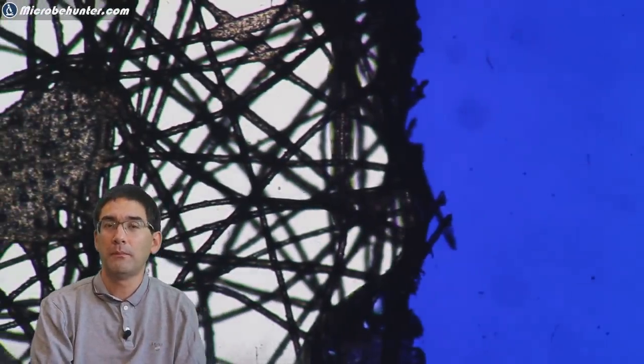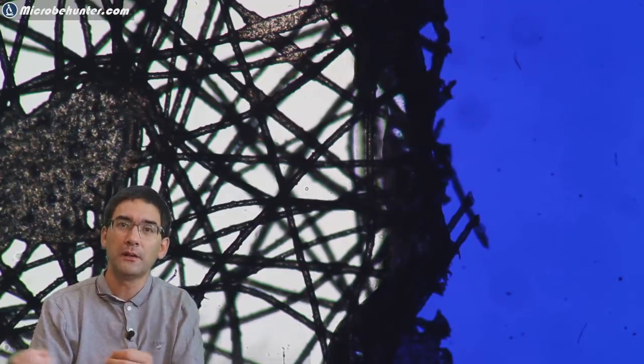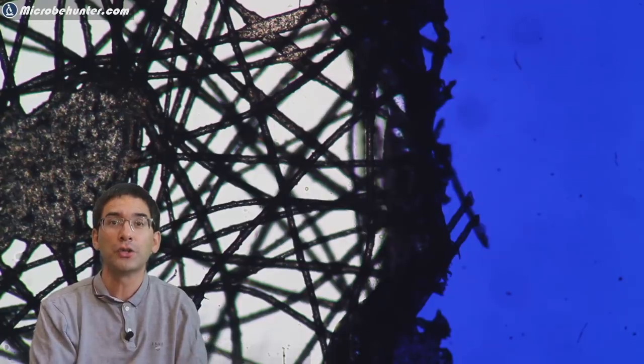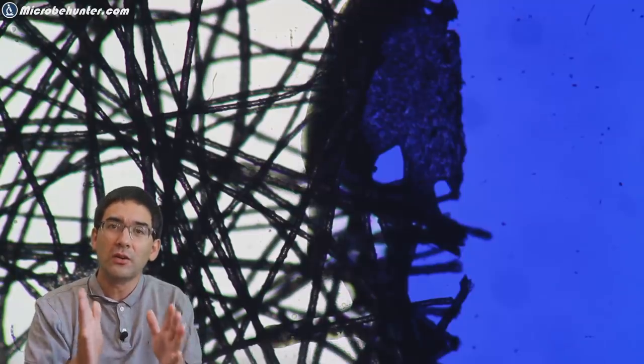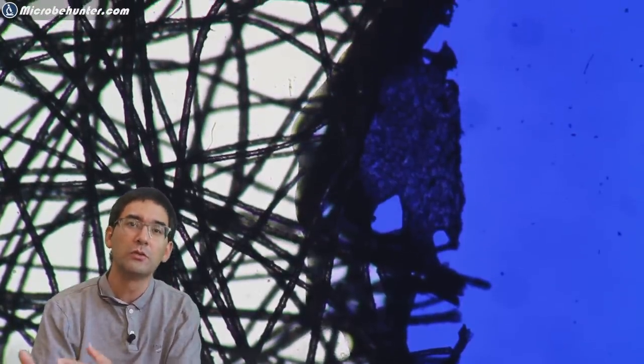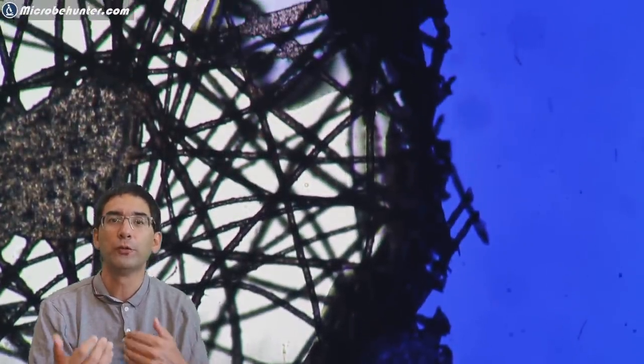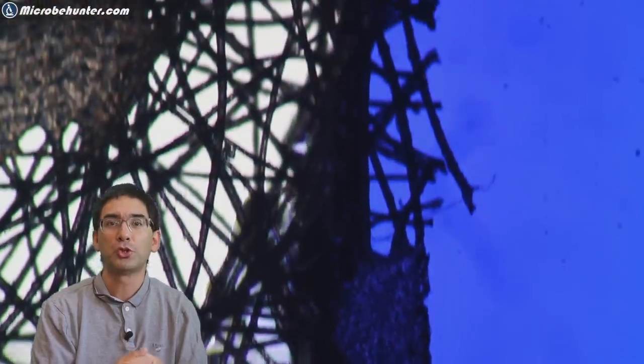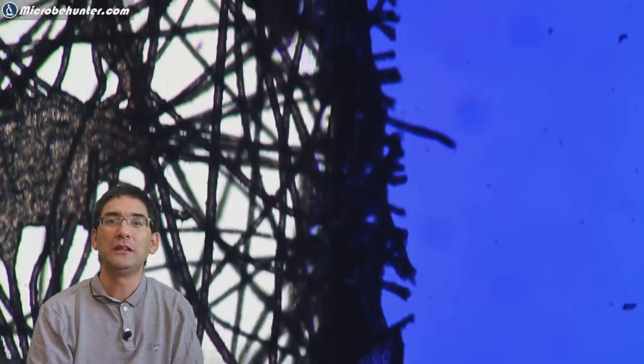When it touches the fibers, I normally would have expected in the case of cotton that it's immediately sucked into the fibers due to capillary action, but this did not happen here. The ink with the water essentially tended to stay on the side and did not want to move in further because evidently the fibers must have been hydrophobic and therefore did not like to interact very much with the water-based ink. This is yet another indicator that we're not dealing with natural fibers, which are quite hydrophilic, but some kind of synthetic material.